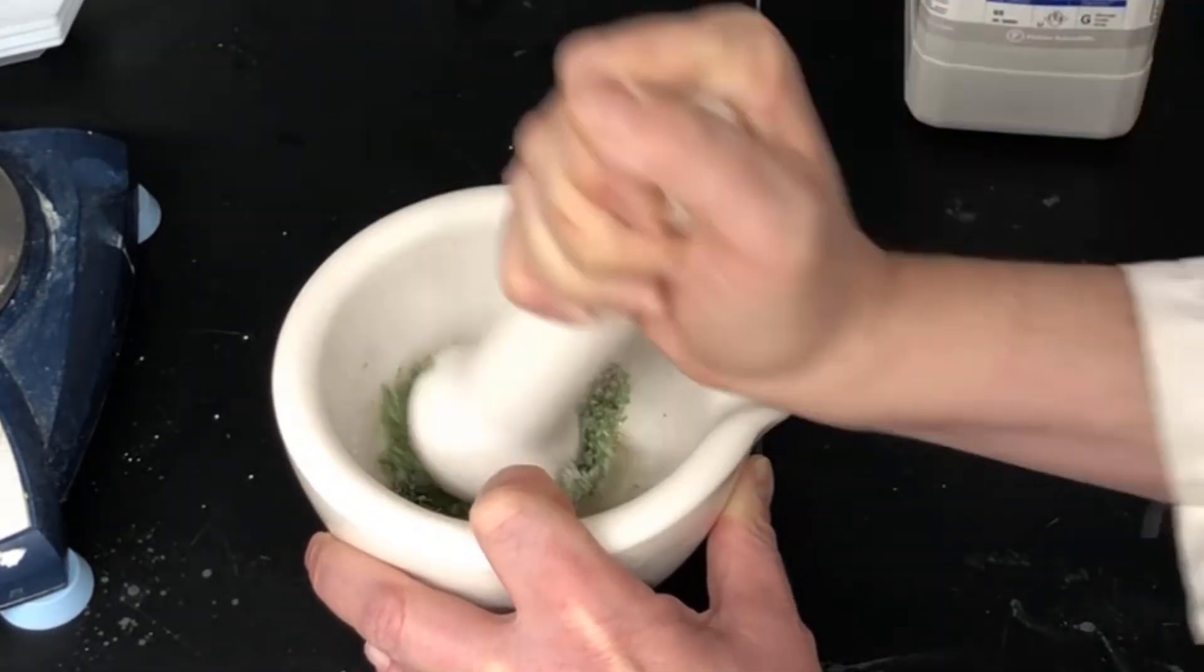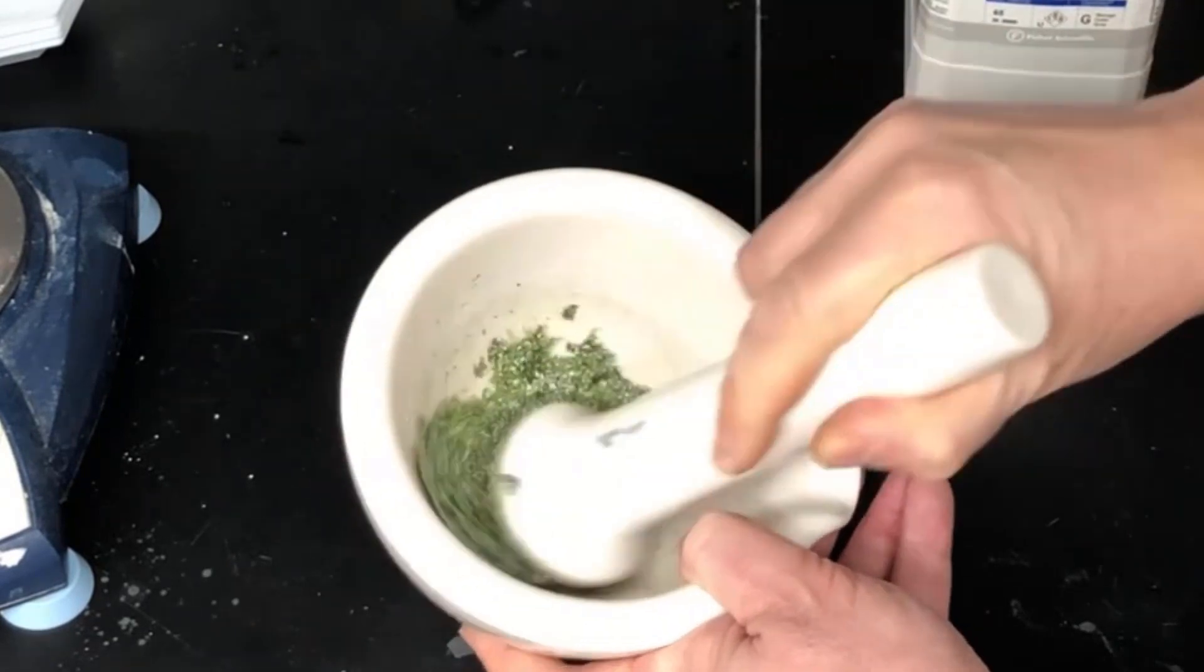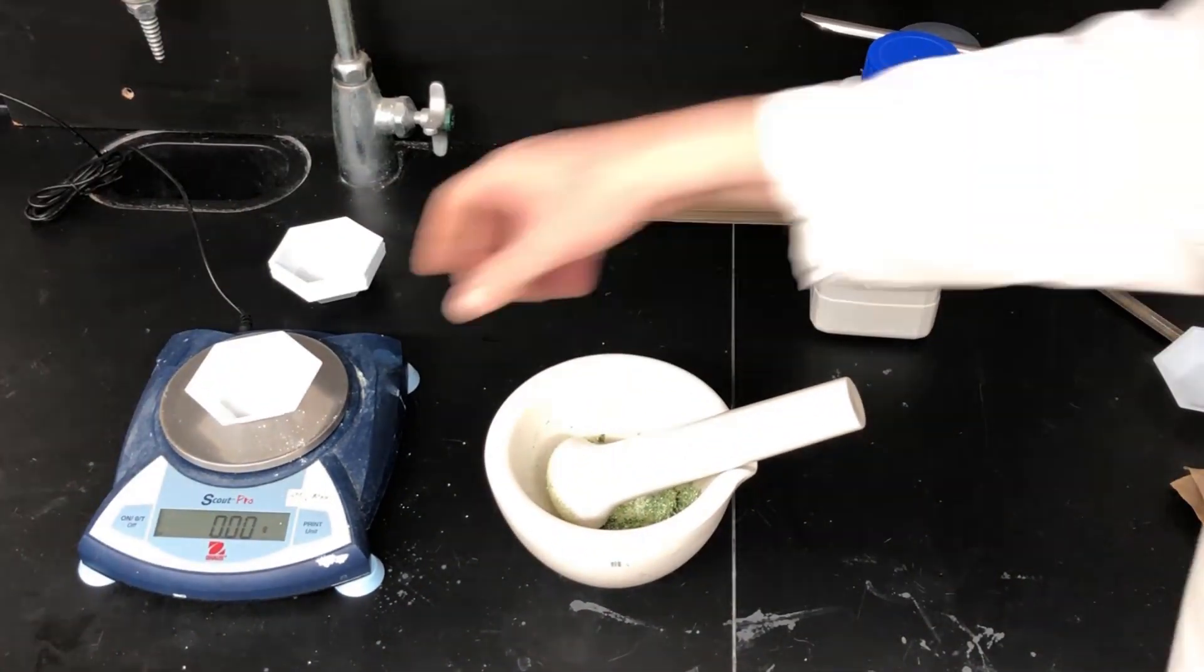And what you can see here is we're getting to the point now where we're getting it kind of homogeneous, but it's still a little bit cakey. It's not exactly a free-flowing solid.